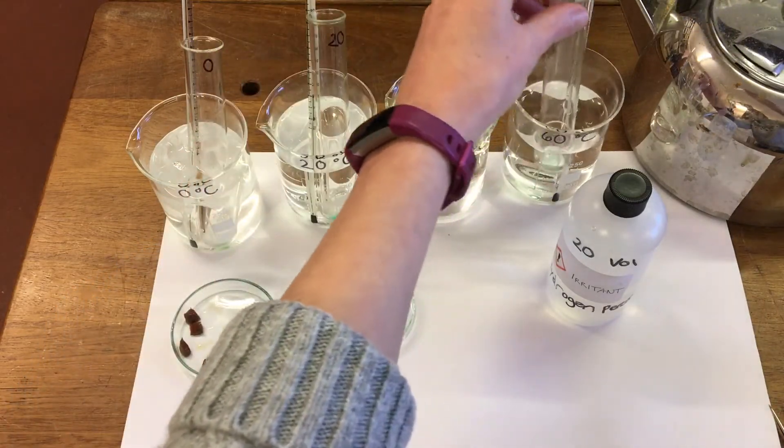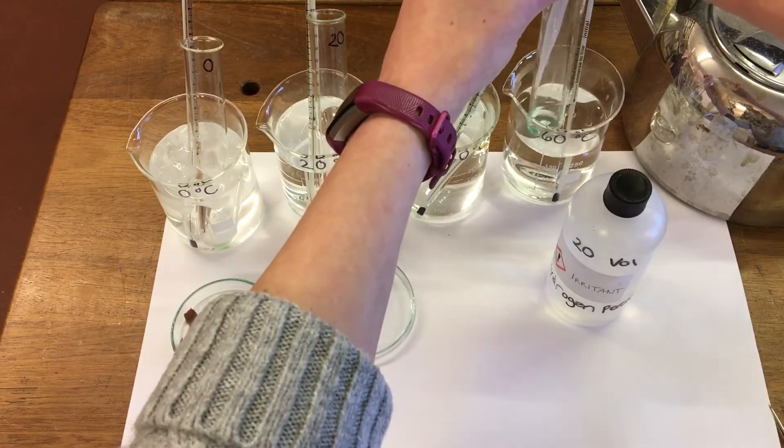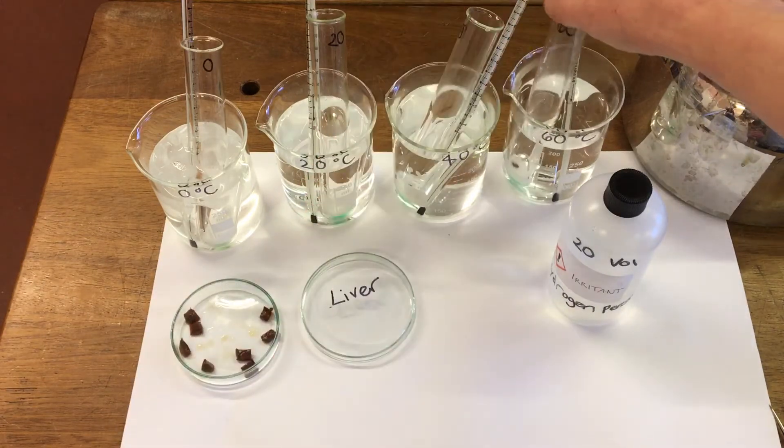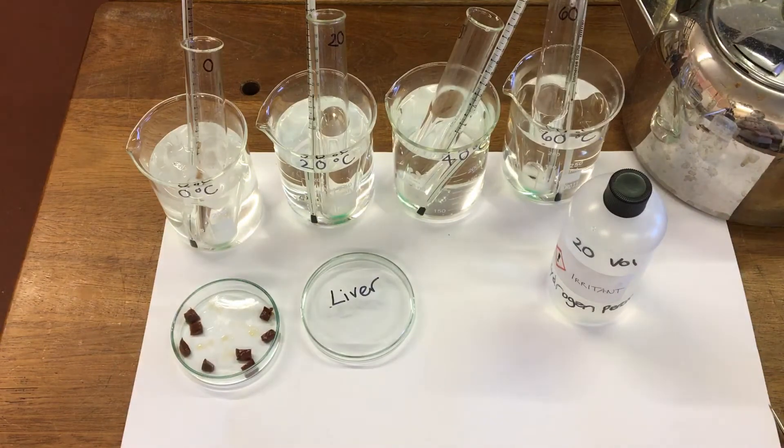And then we're going to leave these at temperature for five minutes. And then we're going to measure the height of the foam produced.